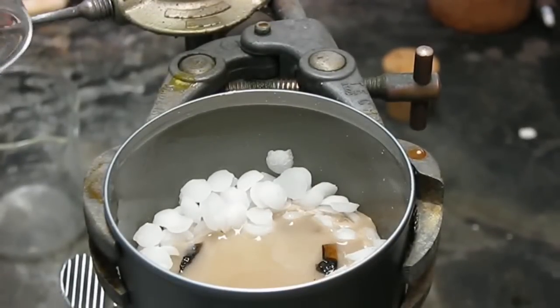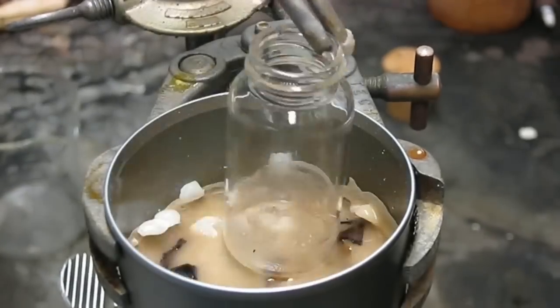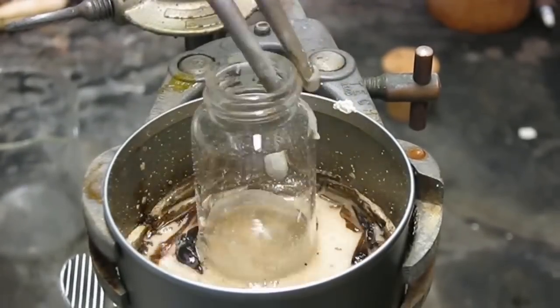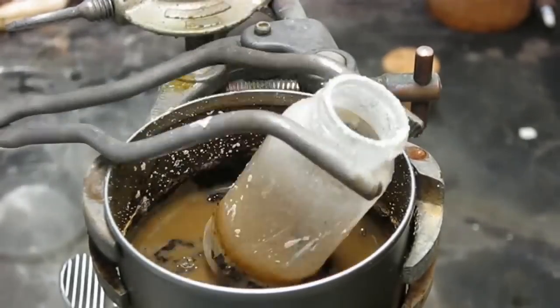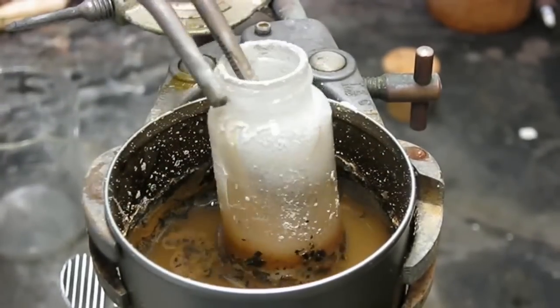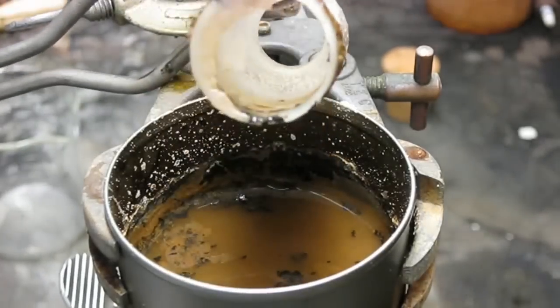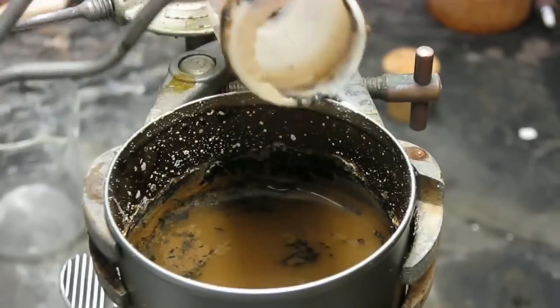It's about ready. Here's the vial. What's happening is the sodium hydroxide is reacting with the silicon dioxide in the glass to form sodium silicate, which is soluble and dissolves away. There we are — look at that. The entire bottom of the vial was etched right off.